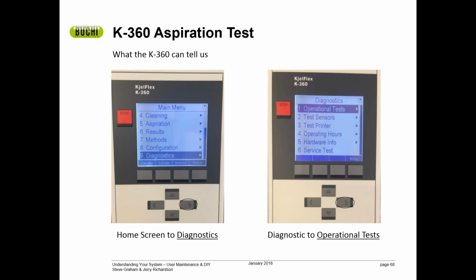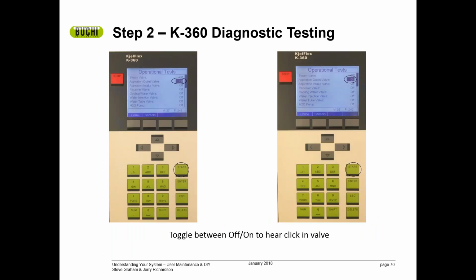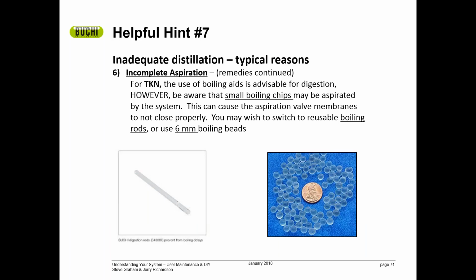Basically we have the same sort of diagnostics tool on the K360. The important lesson in this is go to the diagnostics, turn the valve on and off. If you do not hear it click, then the valve needs to be replaced. If you do hear it click, then most of the time the valve is just fine. So that's a little diagnostic routine that you can do yourself.